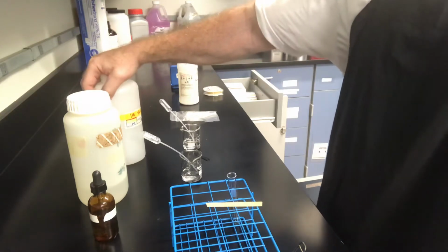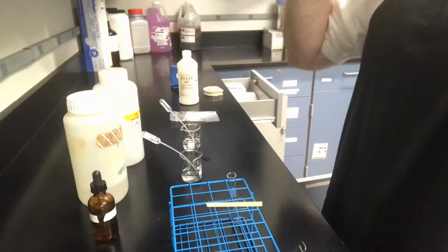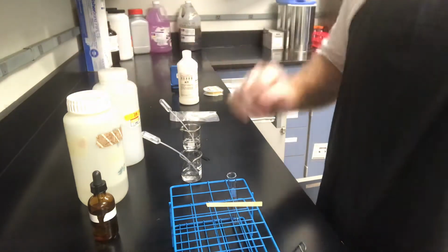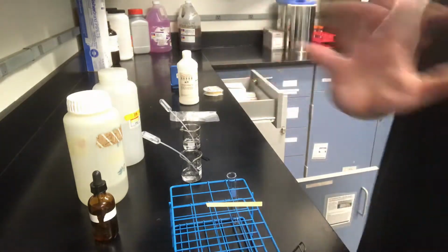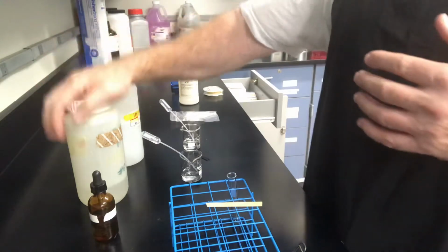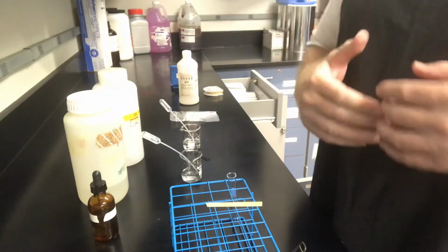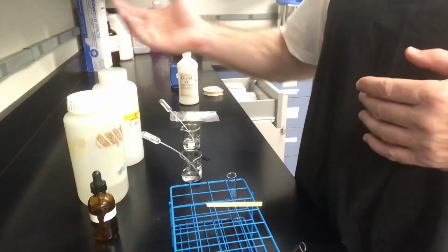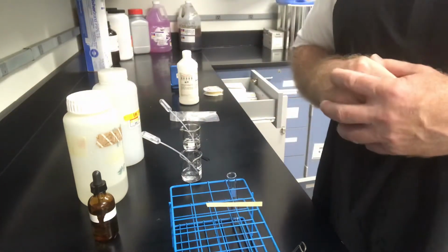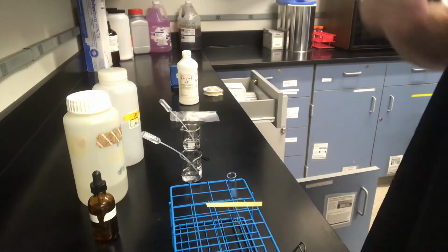It's not quite 1 molar. Not that I'm throwing my colleague under the bus, but I guess I am, it's a little bit off, and hopefully that will not be enough to make a difference in the lab. But this is 1 molar and 2 molar, so I've doubled the concentrations called for by the procedure, from 0.5 to 1 and 1 to 2. All right, so we've doubled the concentration. So you should make that change in the procedure, and it should make sense to you when we get a result, hopefully.